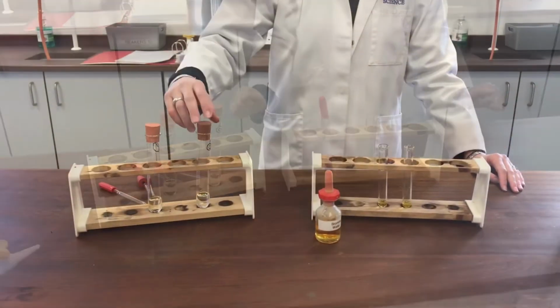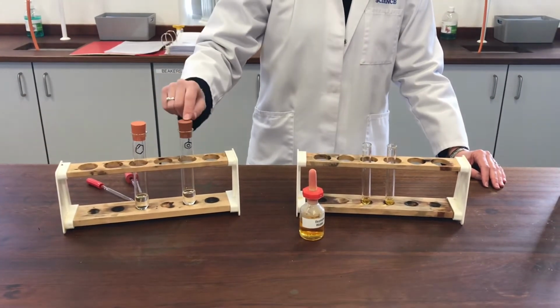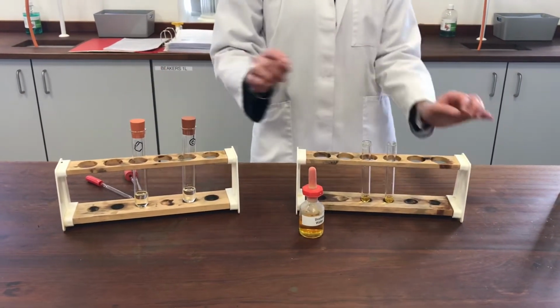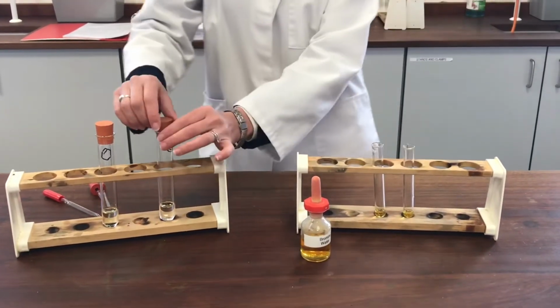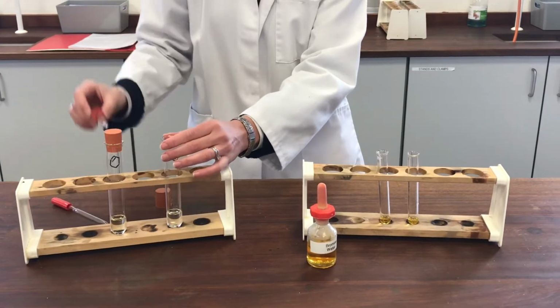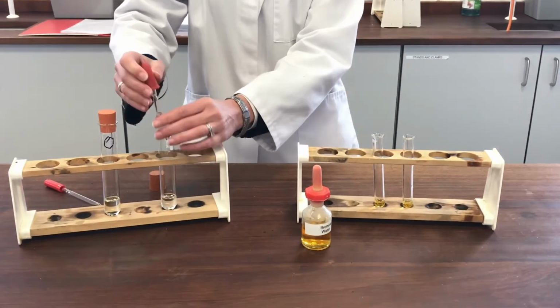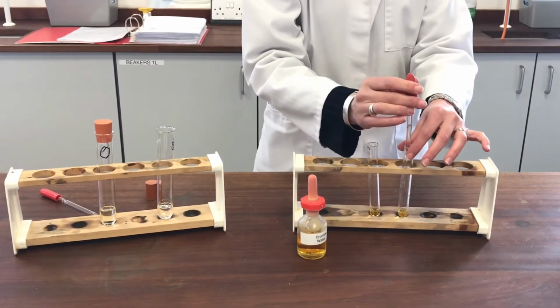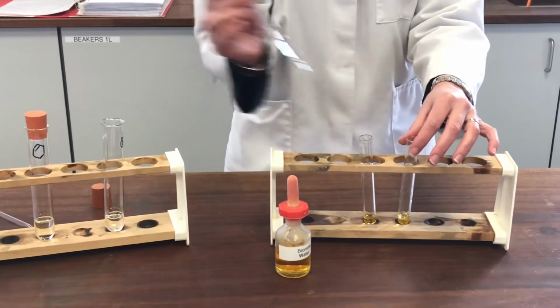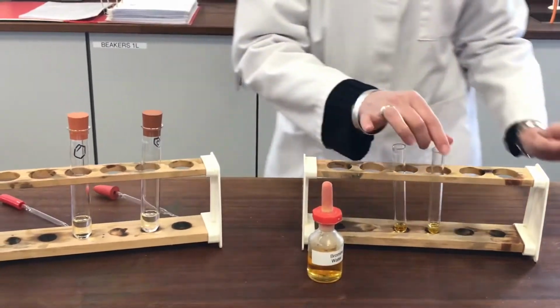Okay, we're now at the third stage of the experiment. So same organic molecules, benzene-based molecule and cycloalkene, and this time I'm going to try reacting them with bromine. So I'll take my benzene sample first. Add a little to the bromine water. I'll give that a shake.